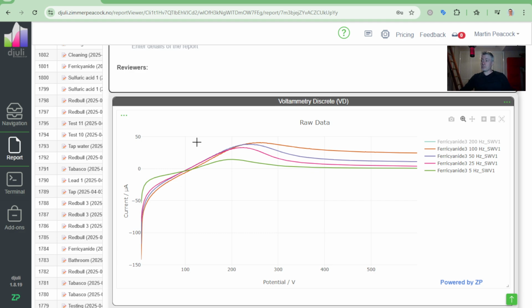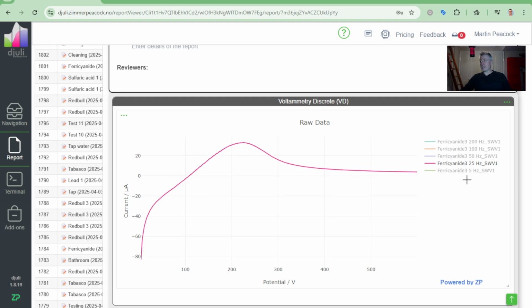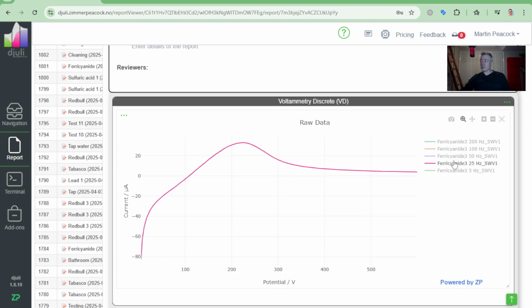The one that looks most peak-like, I would, dare I say, probably be the 25 hertz. I mean, that looks quite nice. The 50 hertz. See, the 50 hertz is actually quite usable. What I mean by that is, if I'm trying to develop an assay, then there's still good signal in there. If you're trying to make an academic paper, I could understand that maybe you'd be a bit more wishing the 25 hertz.